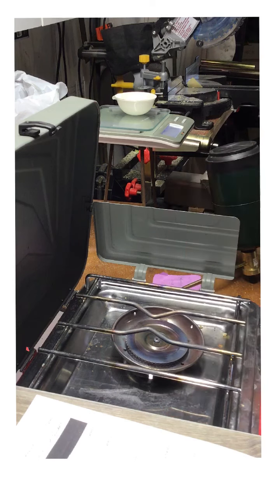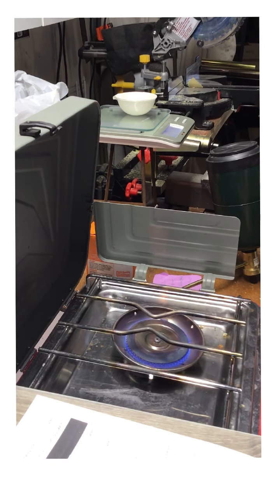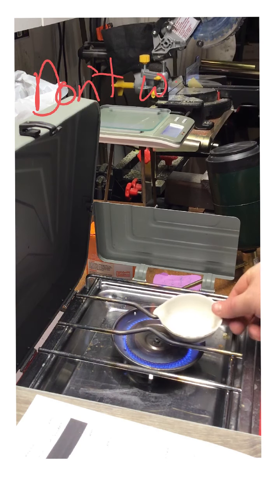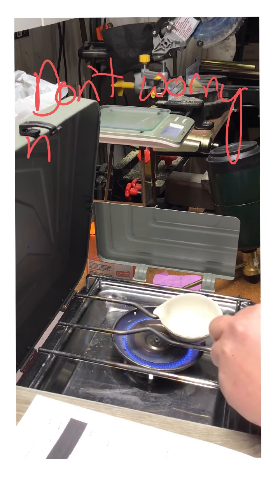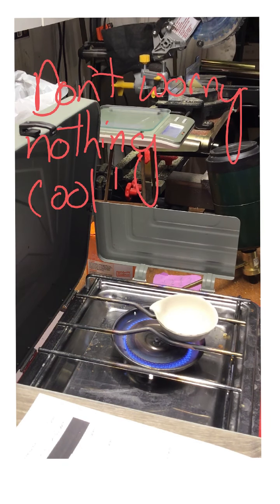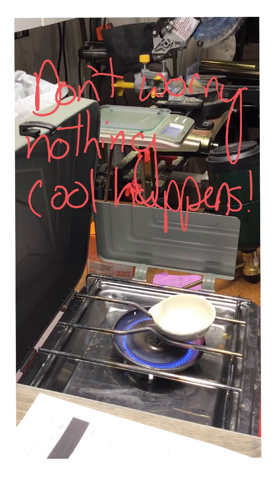Now the next thing I need to do is light this stove. So I'm going to turn on the gas, turn on the flame. And just like a Bunsen burner, I'm going to adjust this to get as much oxygen in there as possible to get this nice blue flame. And then I'm going to put it wherever it kind of sits nicely. And then we're going to heat this, and we're going to come back to it when it's done, and we're going to see what the mass is at the very end. So join us for the second video to figure out the end weight.